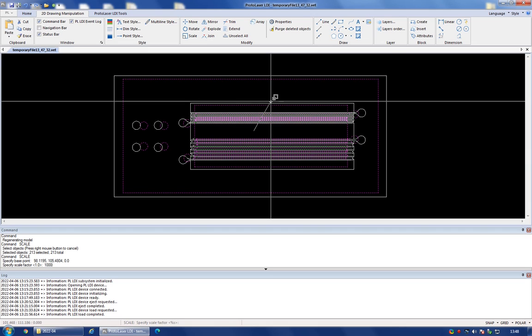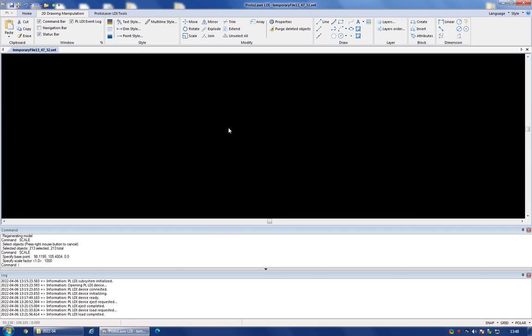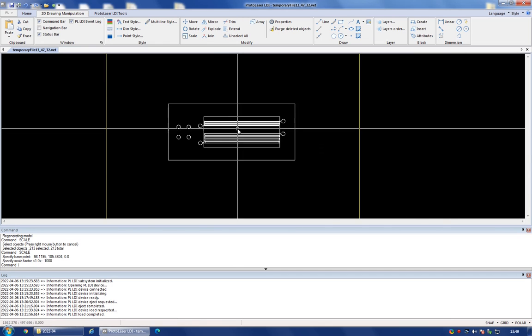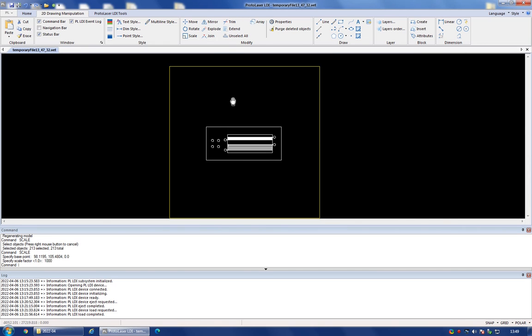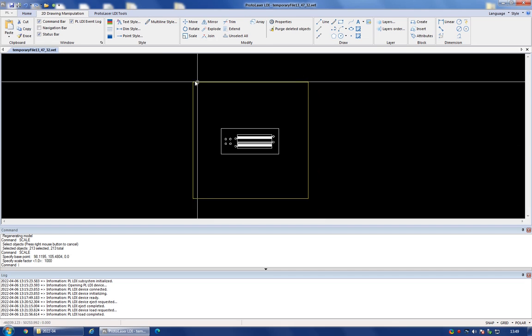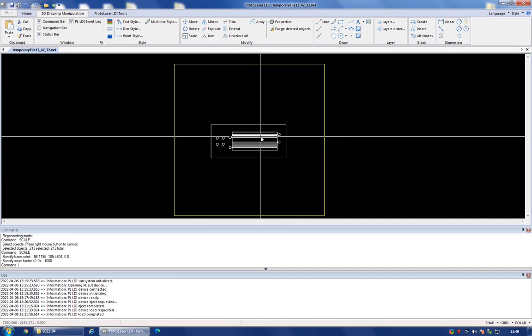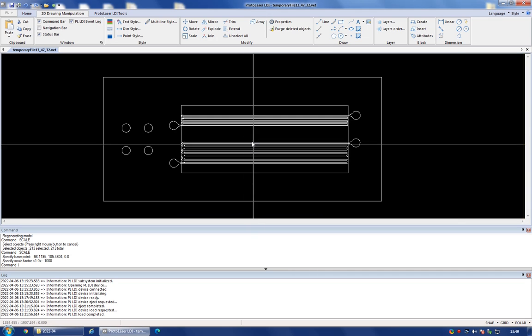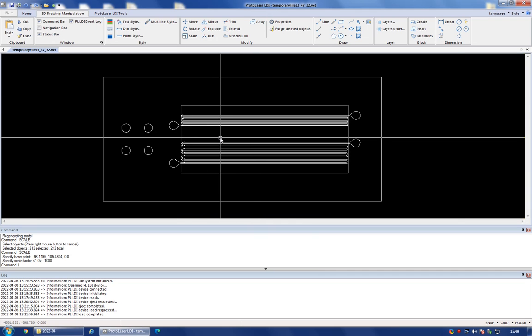So I'm going to hit enter on that, and now I can zoom out, and I can see that the structure that I have is of a reasonable size compared to the yellow square. So the yellow square is 100 by 100 millimeters, so that kind of gives you the scale of this drawing. So moving on to what do we do next.